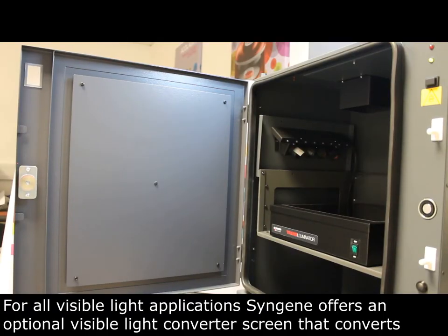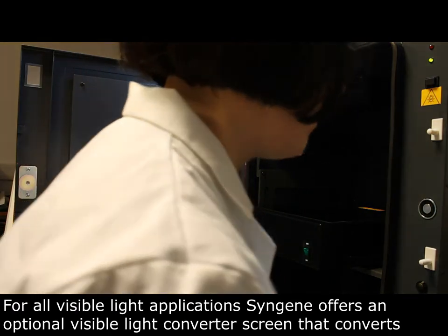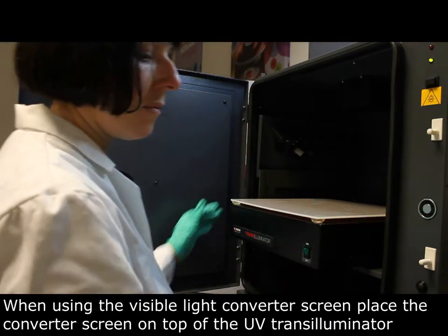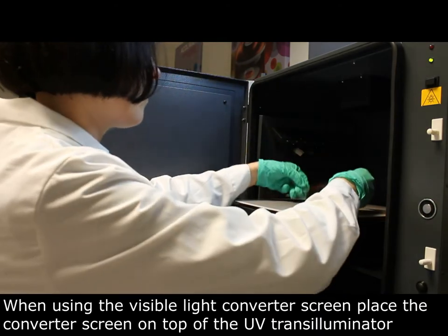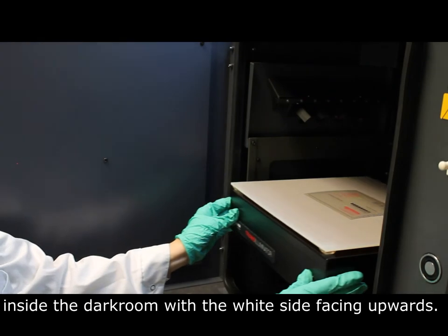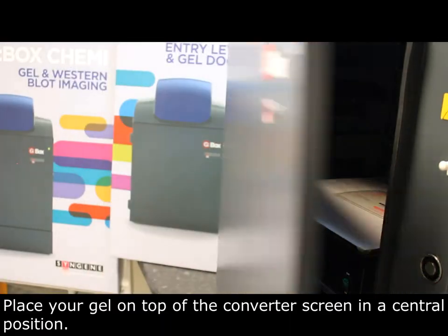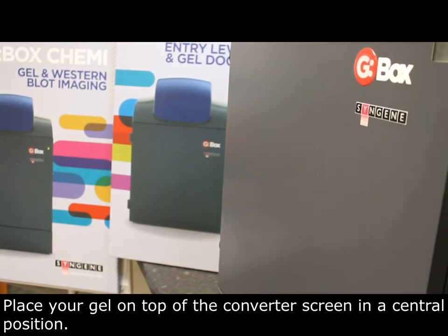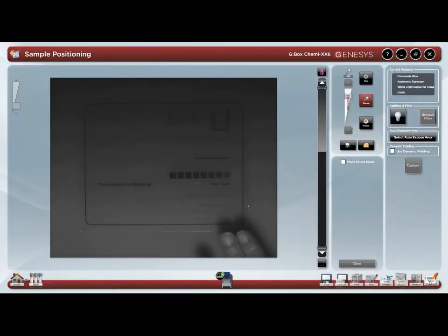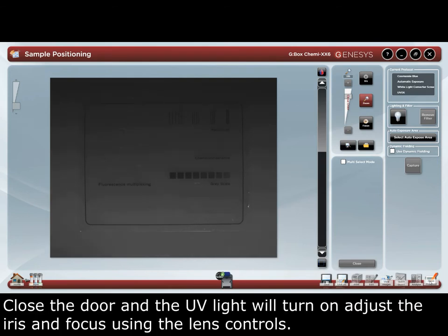For all visible light applications, SynGene offers an optional visible light converter screen that converts UV light to visible light. When using the visible light converter screen, place the converter screen on top of the UV transilluminator inside the dark room with the white side facing upwards. Place your gel on top of the converter screen in a central position. Close the door and the UV light will turn on.